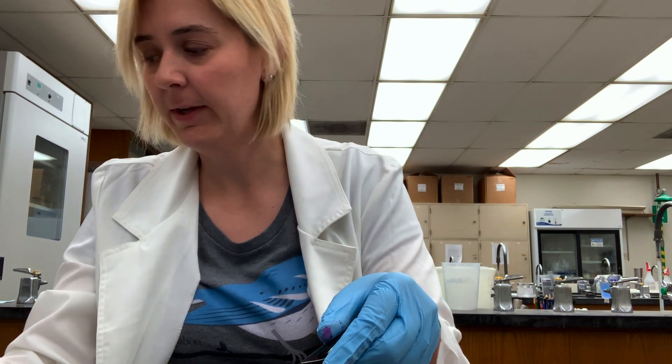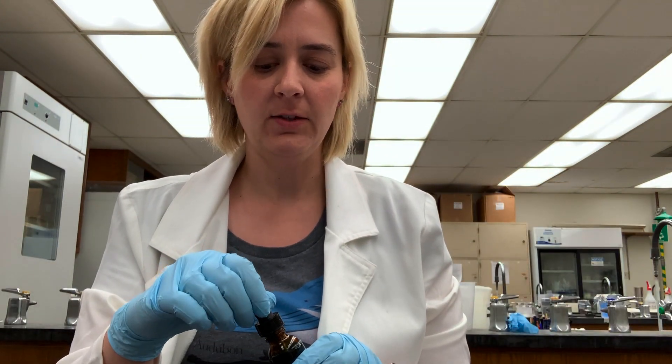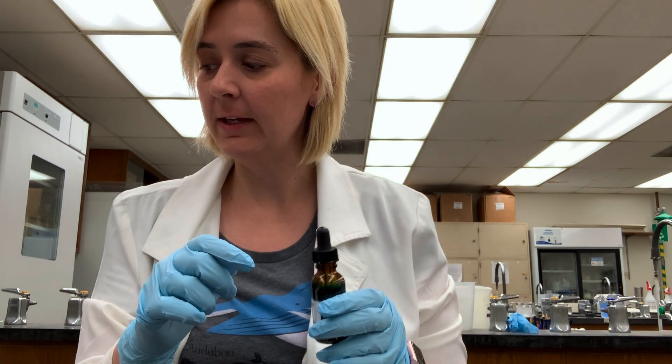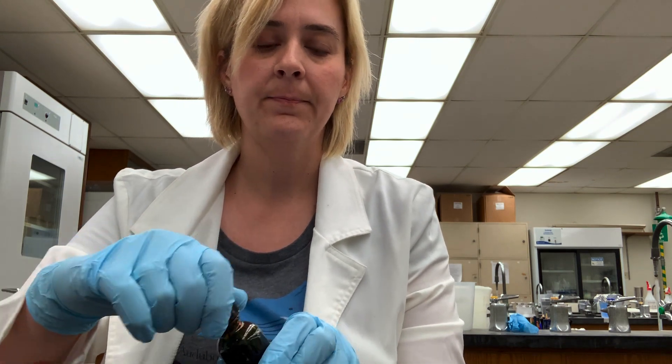That looks pretty good. We rinse with water to make sure we stop decolorizing. Following the acid-ethanol and rinse step, the final major step is to add methylene blue. Methylene blue is a direct stain — cells that do not have mycolic acids lost their carbolfuchsin and will pick up the blue, whereas cells that do have mycolic acids still have their carbolfuchsin. So cells with mycolic acids should be pink, and cells without should turn blue.